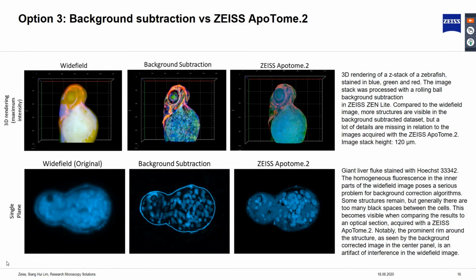The next example here is that of a giant liver fluke stained with Hoechst staining. The homogeneous fluorescence in the inner part of the Widefield image poses a serious problem for background correction algorithms. As you can see in the background corrected image, some structures remain, but in general, there are too many black spaces between the cells. This problem becomes highly visible when the image is compared to the image acquired with apotome.